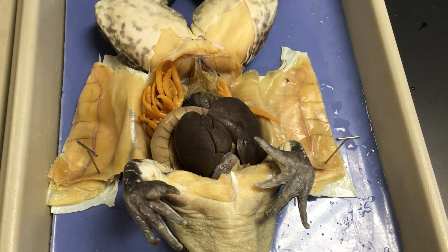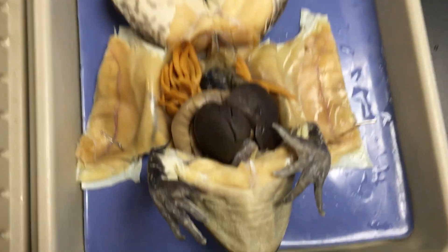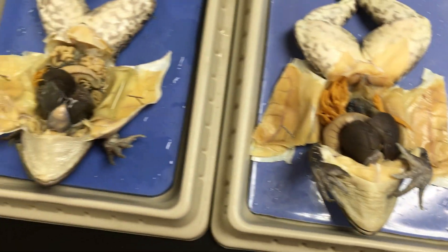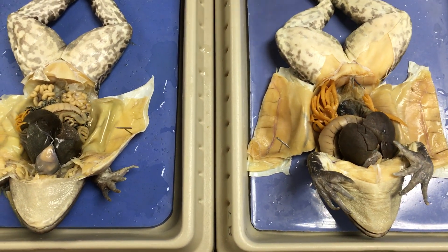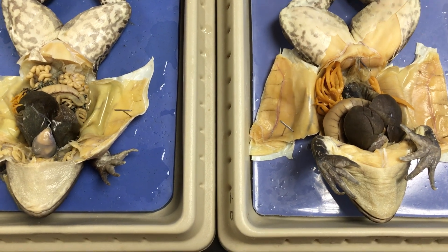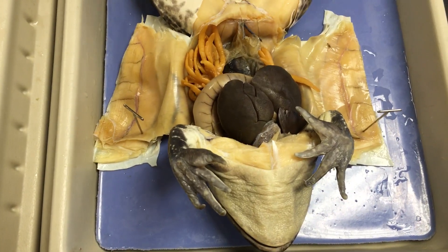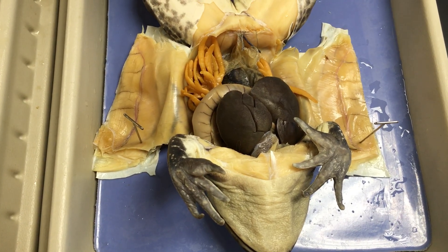Welcome back, 154 students. We are going to look at the internal anatomy of the bullfrog. We've got two here, and we'll switch back and forth to show you good examples of structures. We will also talk about internal sex of these frogs. We'll make some hypotheses as to what we think they are, and then looking at their internal organs, confirm that. Before we get to the sex, let's start with some of these internal organs.